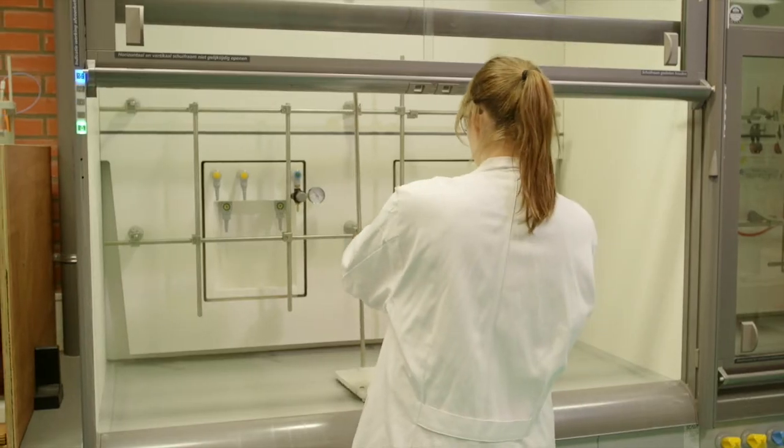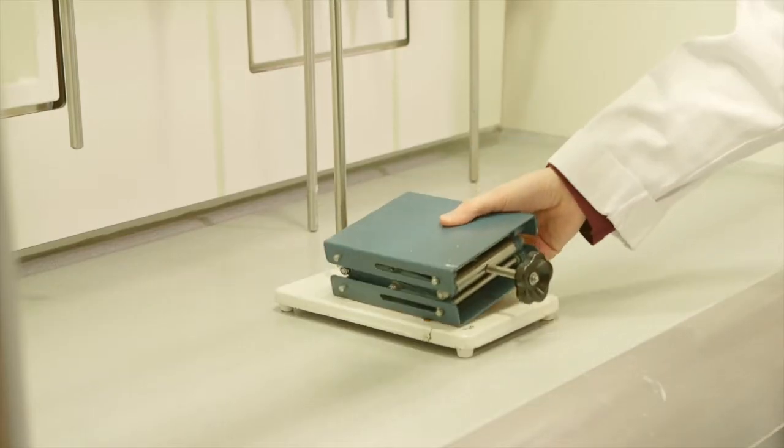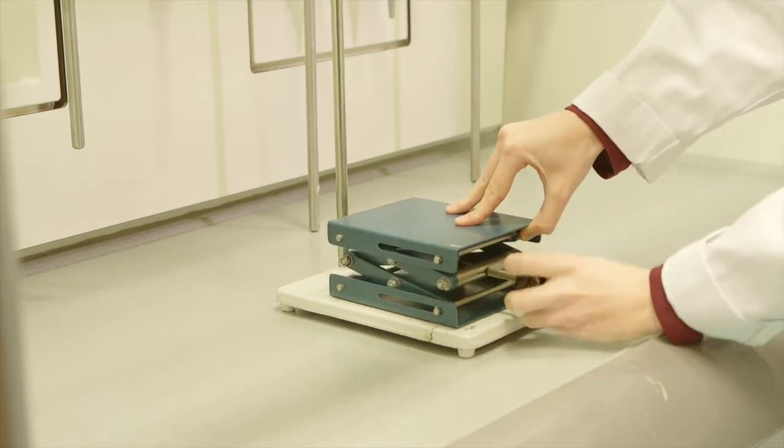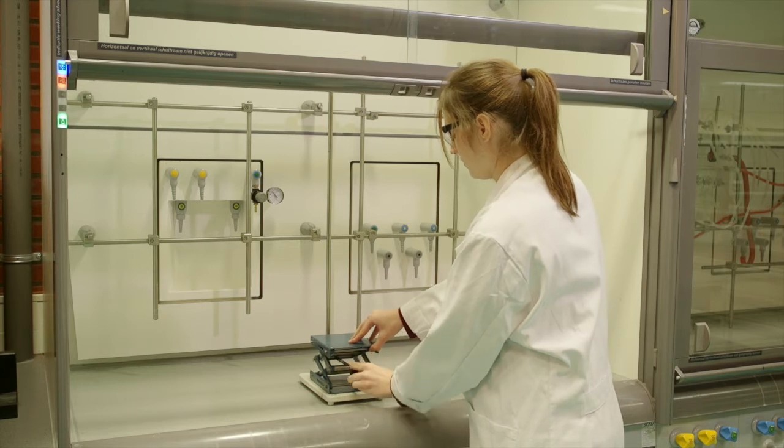Put the stand in the fume hood. The support jack is on the foot of the stand. Note that you set up on the foot of the stand and not next to it. If it is set up next to it, it may fall over.